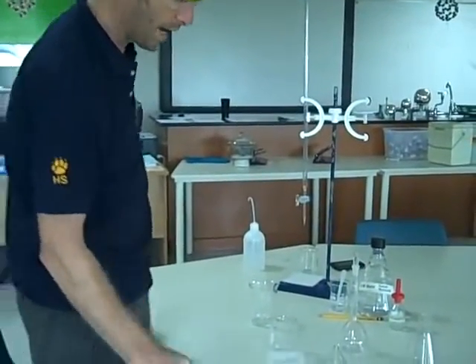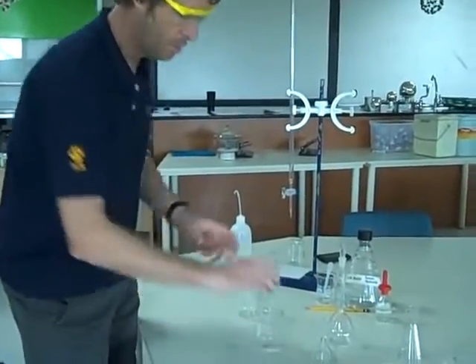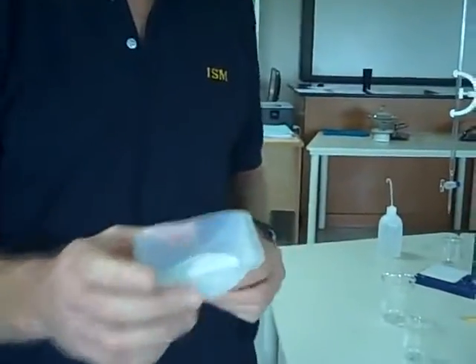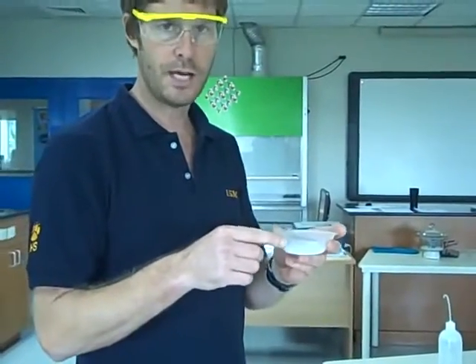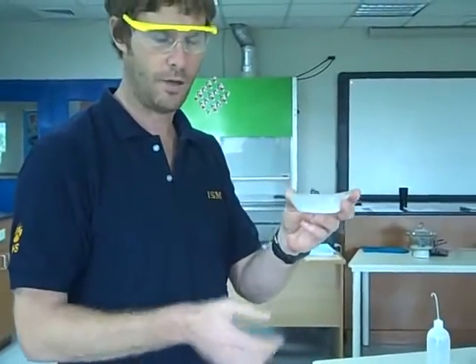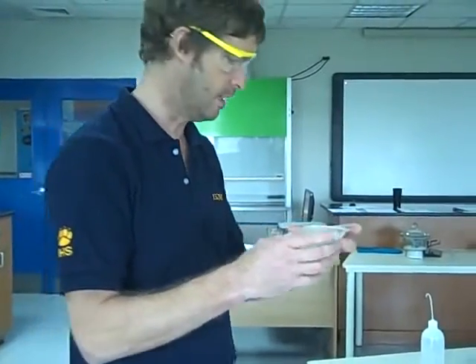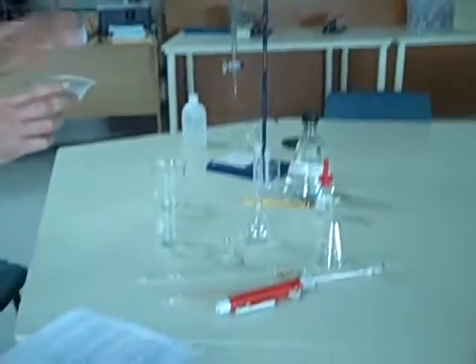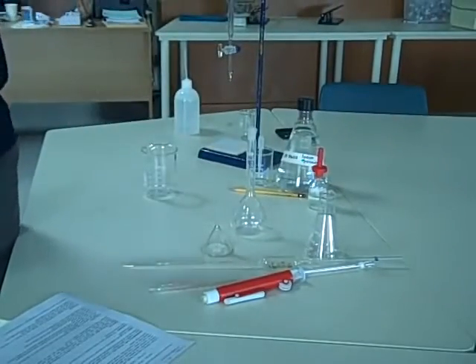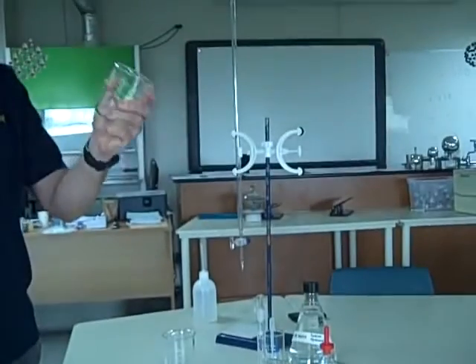You've got a piece of paper that tells you what to do. The first thing it asks you to do is to weigh out approximately 1.5 grams of the oxalic acid. I've done that already. I've measured approximately 1.5 grams into my weighing boat using a balance, but I do know precisely to three decimal places what the mass is. So the first thing I'm going to do with that is dissolve it in distilled water. I'm going to dissolve it in a clean beaker first of all.